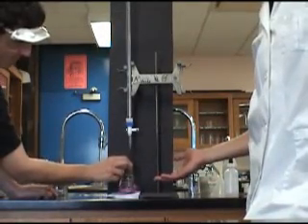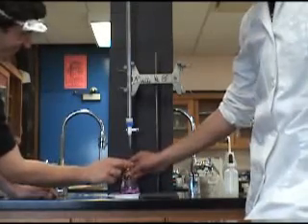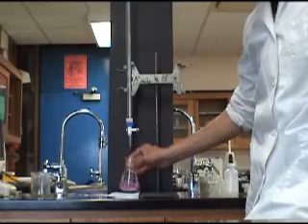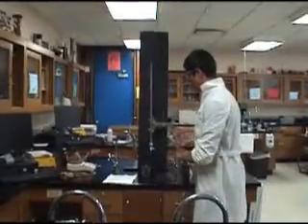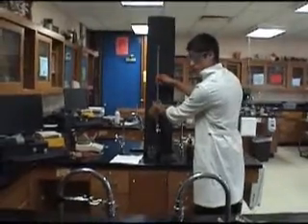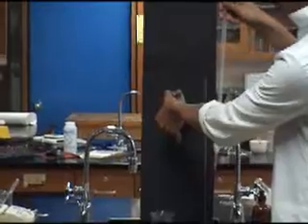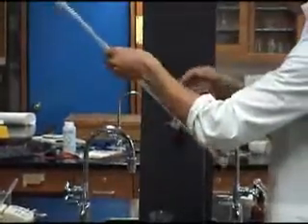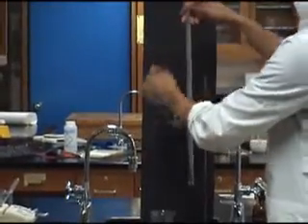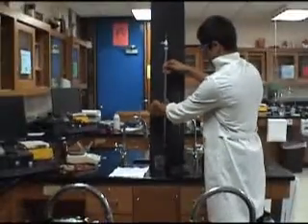Once the flask has stayed in a constant salmon pink color, you are now done titrating. Congratulations, you've just completed your titration. The final thing you want to do is rinse your burette out with distilled water, then proceed to turning it upside down and placing it in the burette stand. Once this is completed, open the nozzle on the burette and allow the excess NaOH or water to drain.